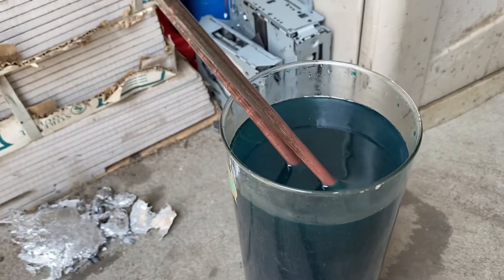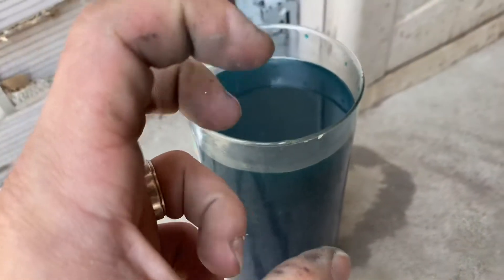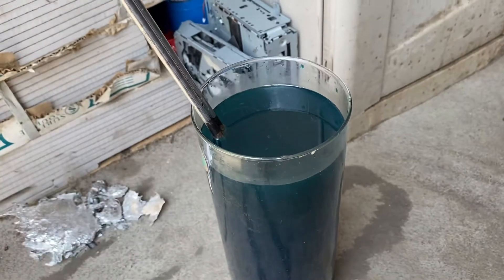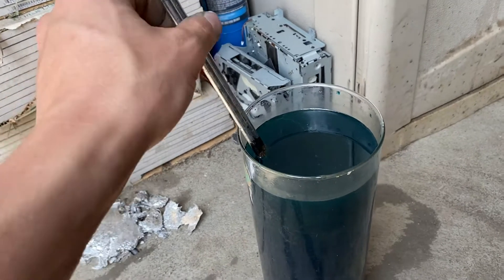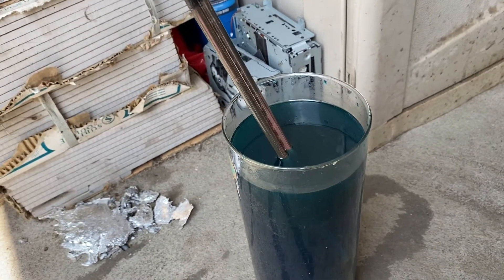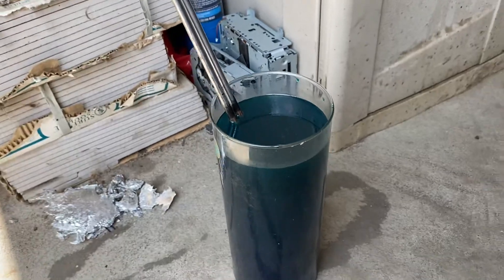That's just the reaction of the steel with this waste solution. I don't call it waste because copper is going high now, and people are paying one to two dollars an ounce if you pour it into a bar. So that's why I'm extracting it. If you didn't know that you can recover your copper just by putting steel into the waste solution, now you know.